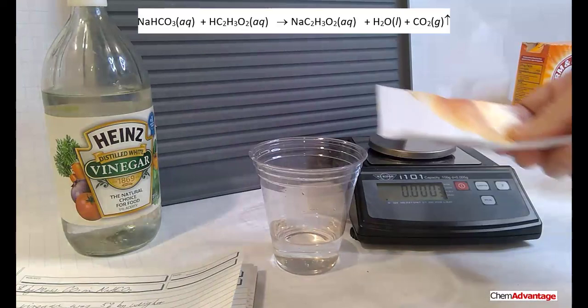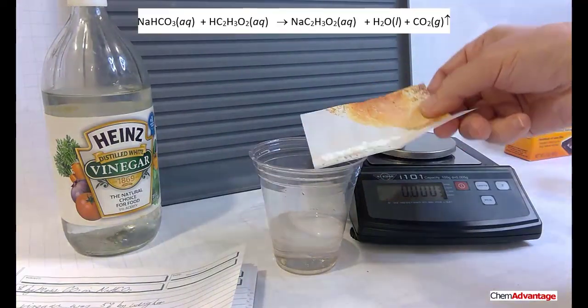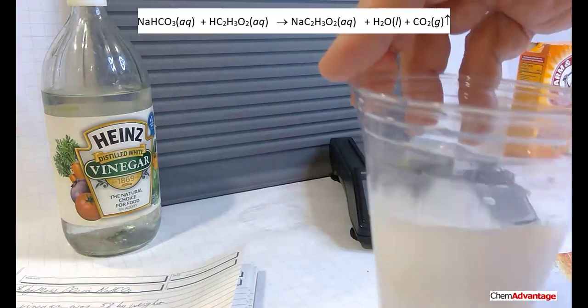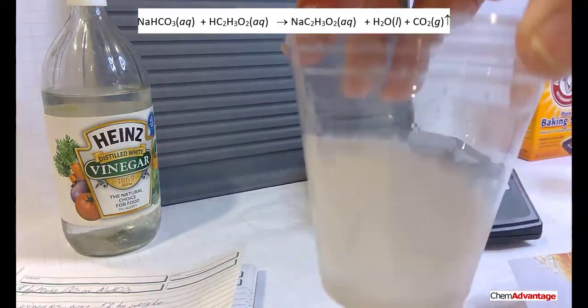Okay, that's been reacting nicely. Here we go, a little bit more. Getting brave, dumping a bunch more in. Whoa, you can hear it. There. Not sure if you can make it. Oh, okay, careful. React, react, react.